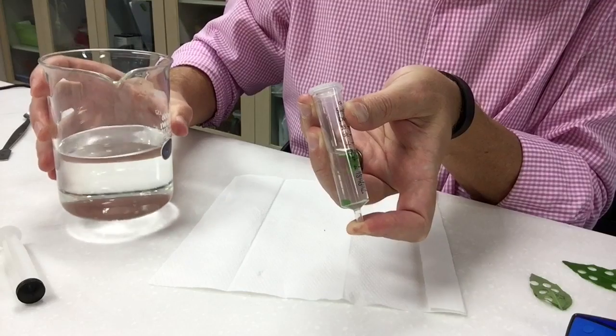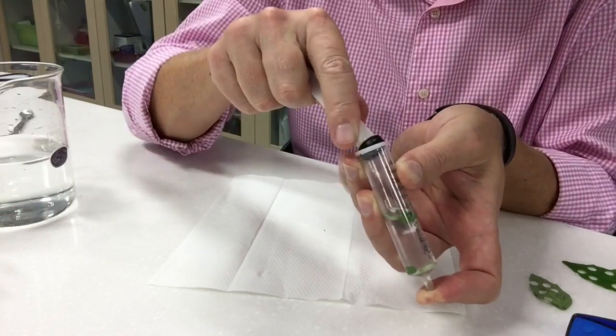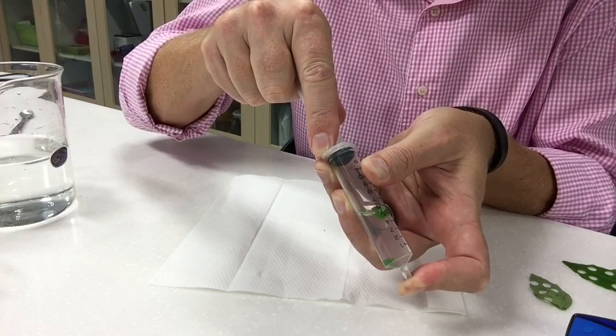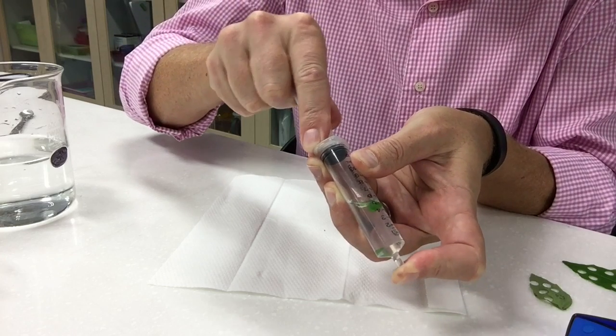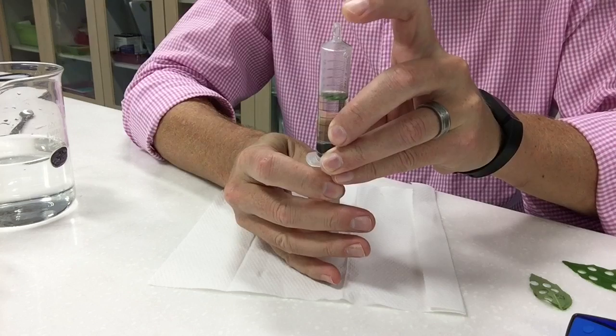I've got about six in there that's okay. Then you want to take the plunger and tease it in there. That's going to create a bit of a suction so then you want to lift up and let that out.